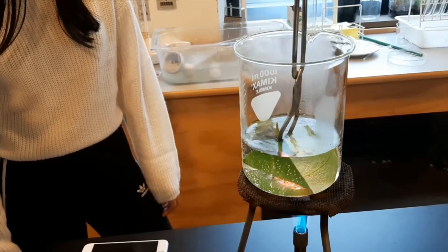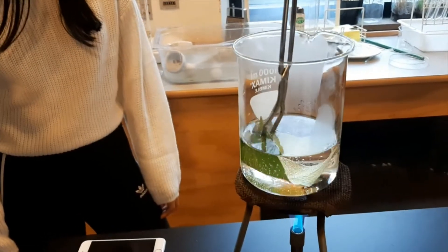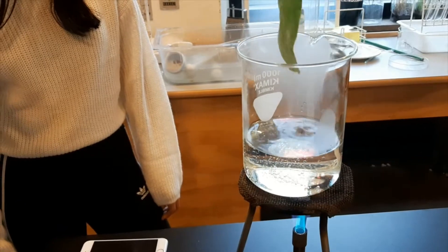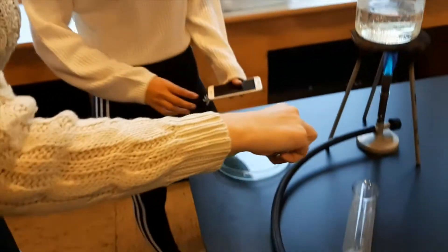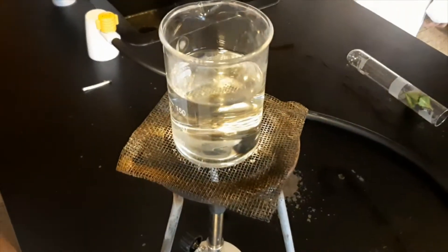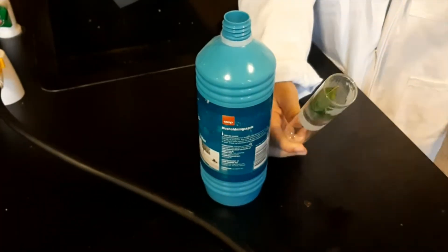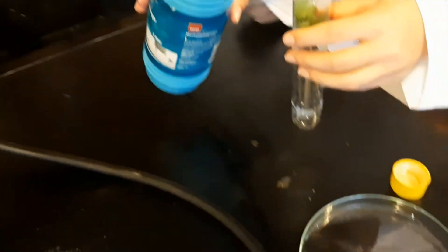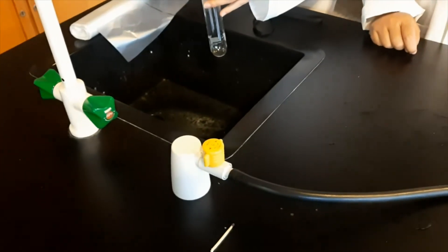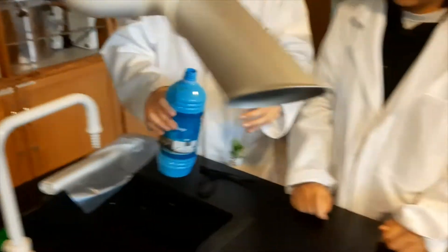All the leaves are ready for the next step. Now we have boiled the leaves, so we take our test tube and put a little alcohol in it. That's enough — just stuff the leaves down the test tube.